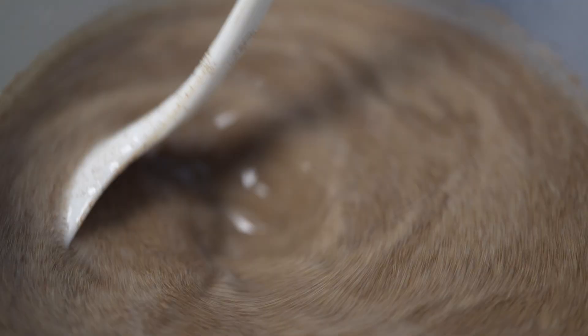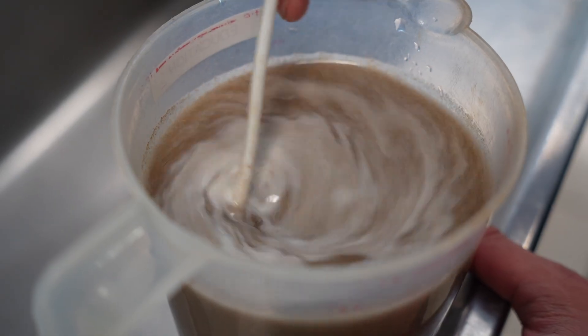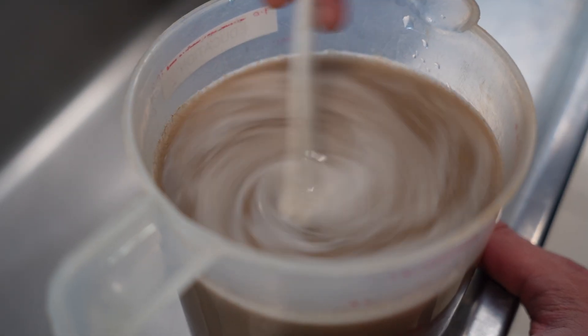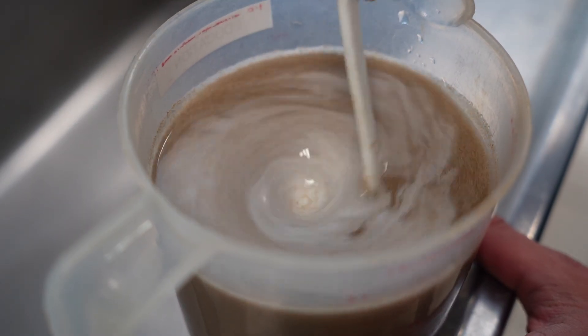And then we stir. We're first just stirring it in just so that it's making contact with all the eggs. It'll take a little bit for the reaction to start. The foam forming on top is now the bleach reacting with the eggs. As it starts to eat away at the cyst, the outside shell of the egg, it forms this white foam on top.